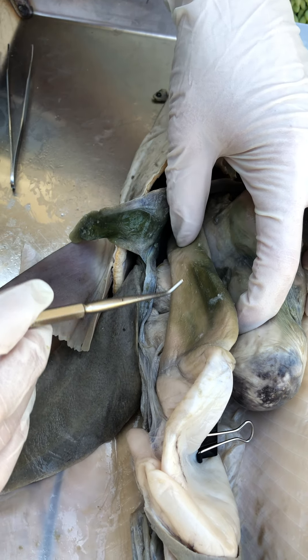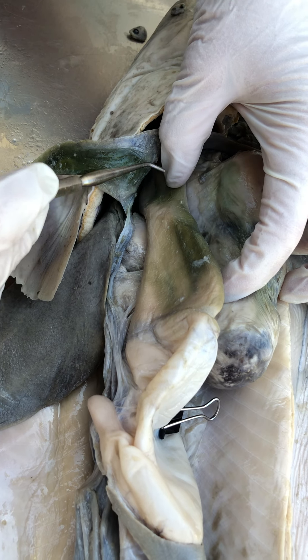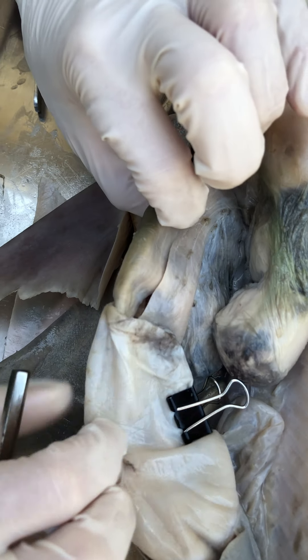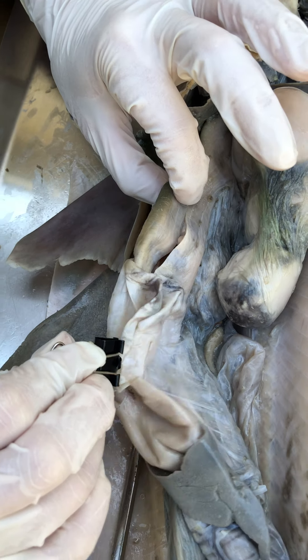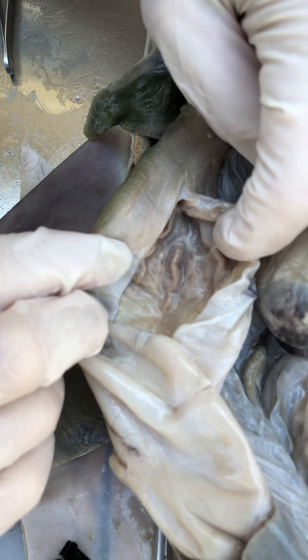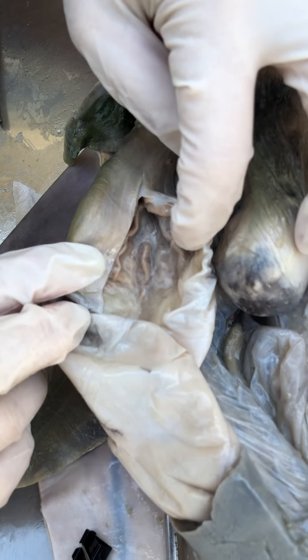The esophagus feels a lot more muscular here. If we were opening it up and saw those papillae, we'd identify it as esophagus. The stomach has two regions. This part is called the cardiac stomach — see those folds? Those are called rugae, and that's how you can tell you're in the stomach.